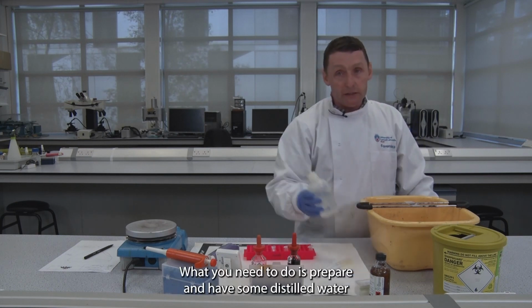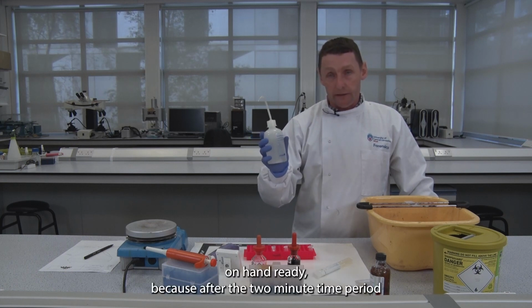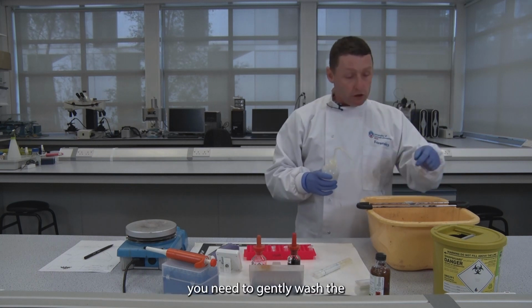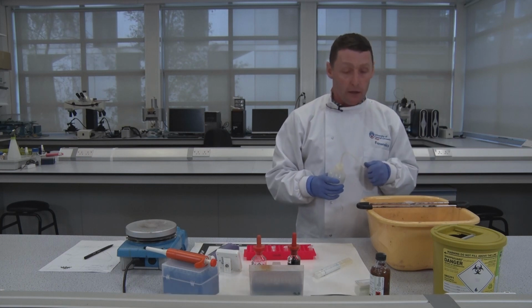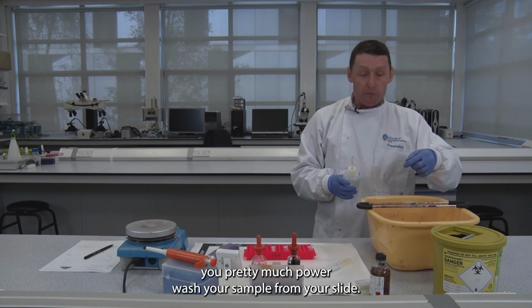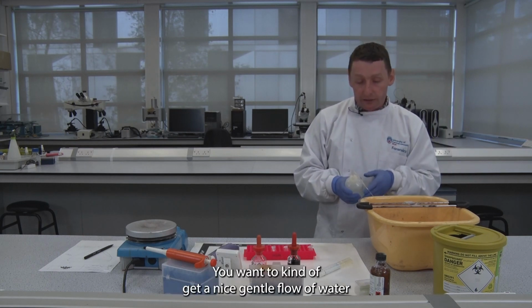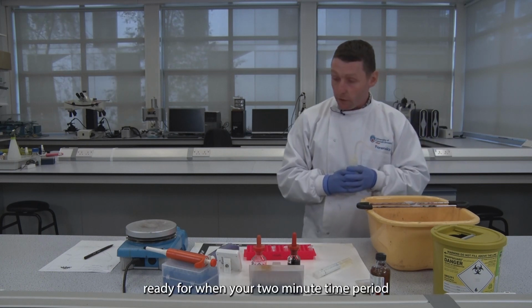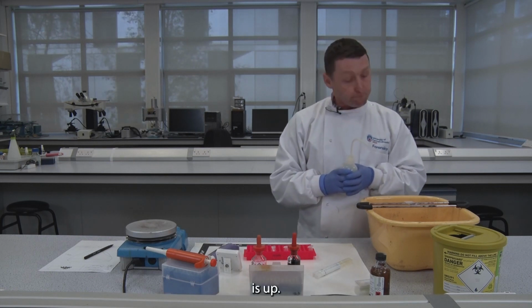While that's happening, you need to prepare and have some distilled water on hand ready. Because after the 2 minute time period, you need to gently wash the Harris hematoxylin stain from your glass slide. You might want to do some tests, because if you press too hard, you pretty much power wash your sample from your slide. You want a nice gentle flow of water ready for when your 2 minute time period is up.